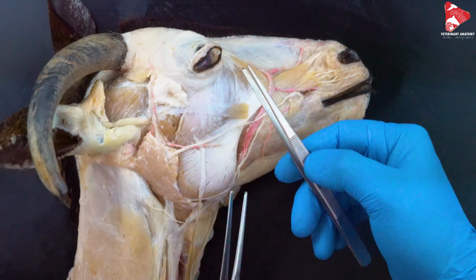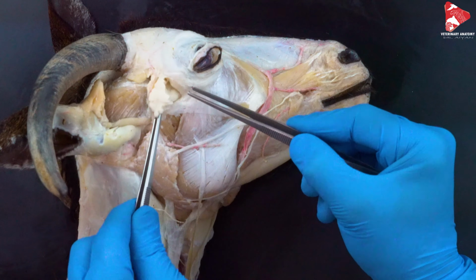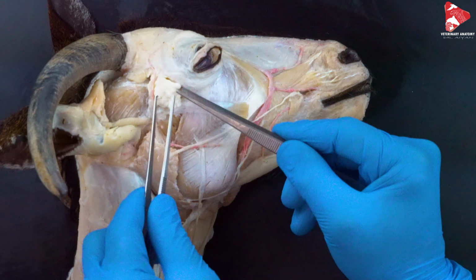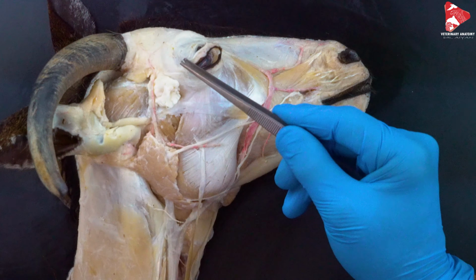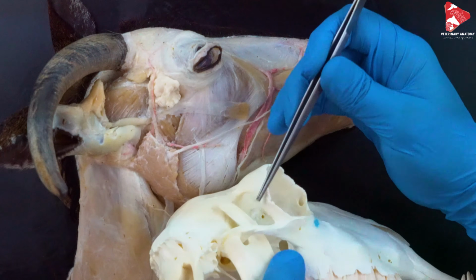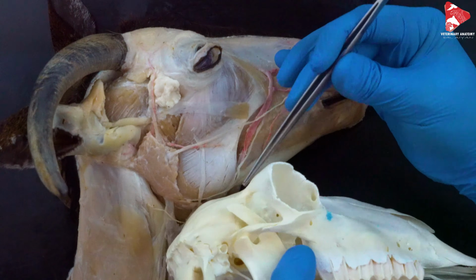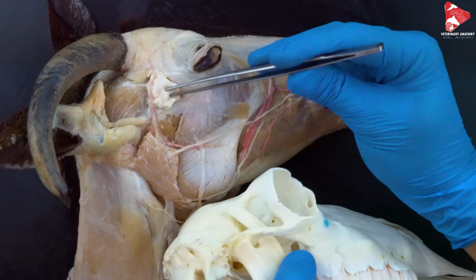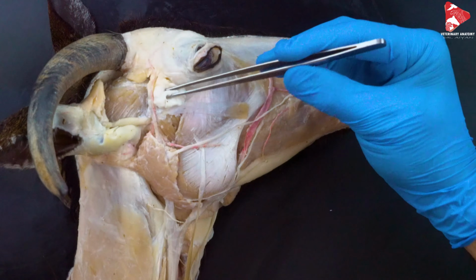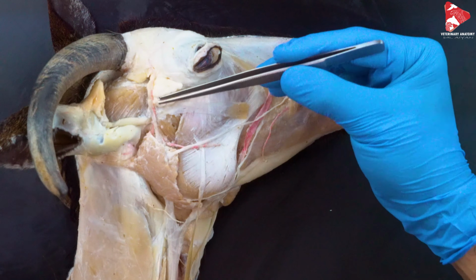In this view here, you can see this fat pad, this fat structure, which is located just behind the eyeball here, and the main function of this fat is to protect the eye from behind. So the location of this fat is again exactly behind the eyeball, behind the orbital cavity. So this is the orbital cavity here. Just in this area here, you will find this fat to protect the eye from behind. We will remove it later to be able to see the muscles of the eye. Let's keep it in place now.